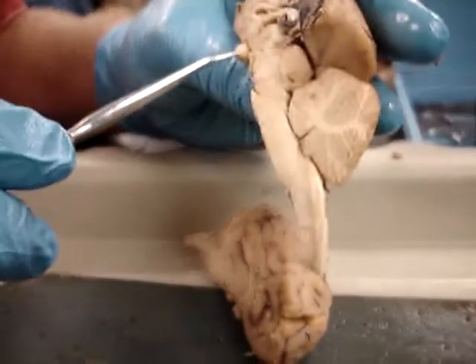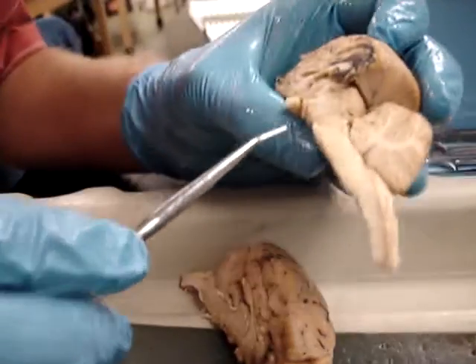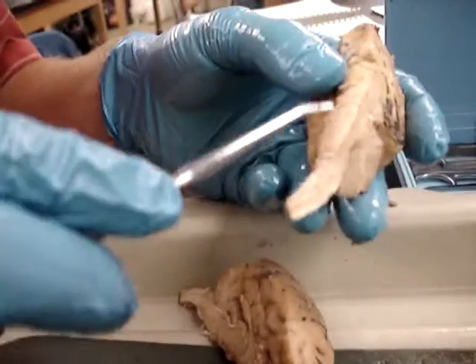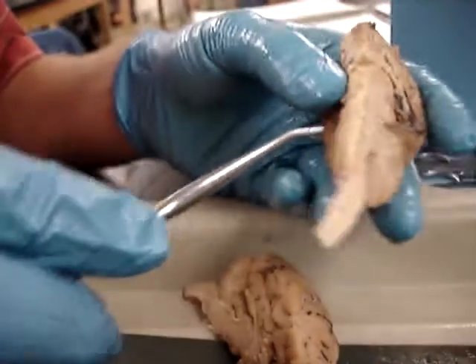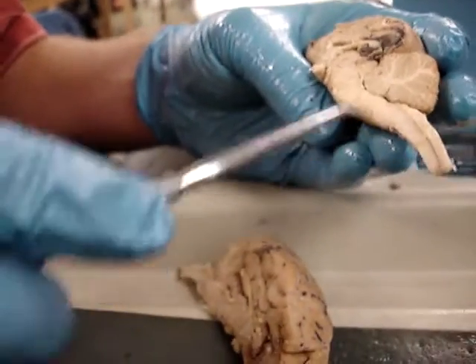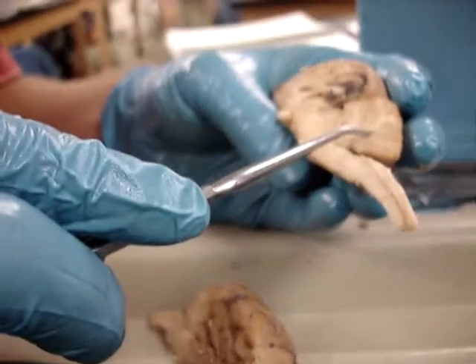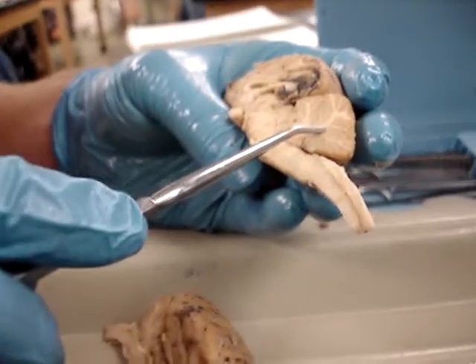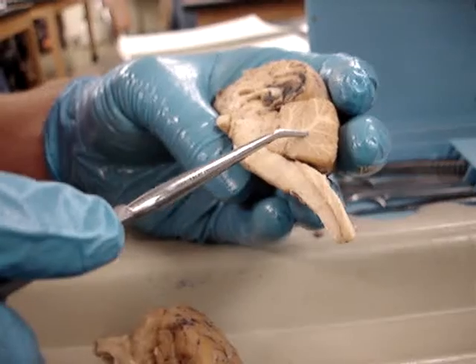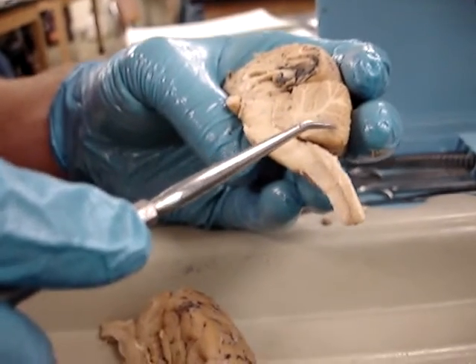The first bump up here is the optic chiasm. Obviously this part back here is the medulla oblongata and the spinal cord. The arbor vitae, and in between that's the cerebellar cortex.